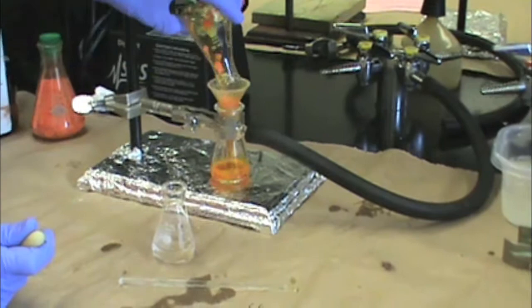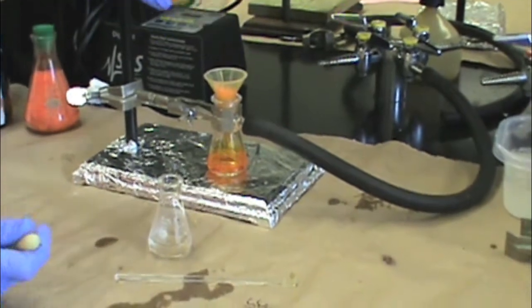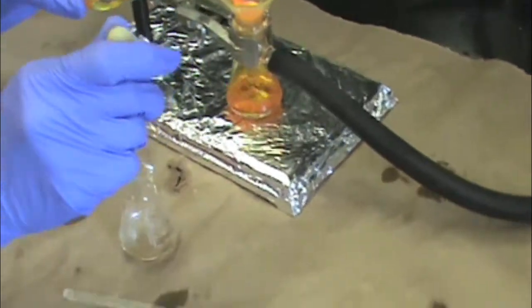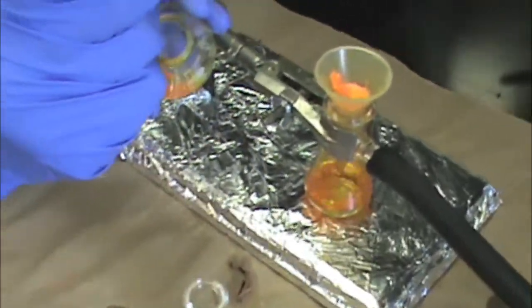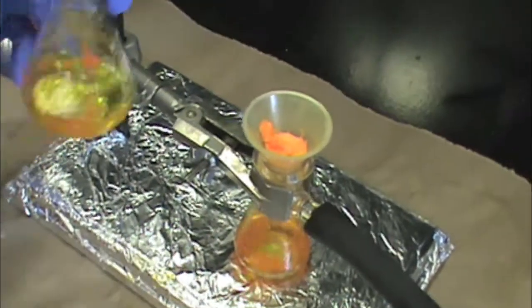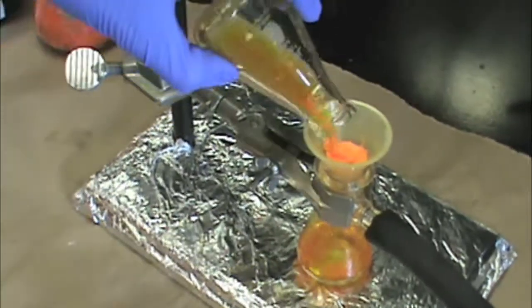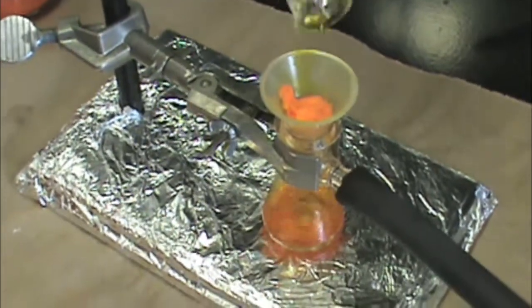Swirl and put the crystals into the Hirsch funnel. You may need to add a few milliliters of solvent at a time to make sure that you get all of the crystals out of your flask and into the funnel.